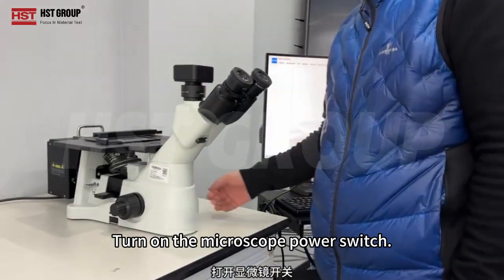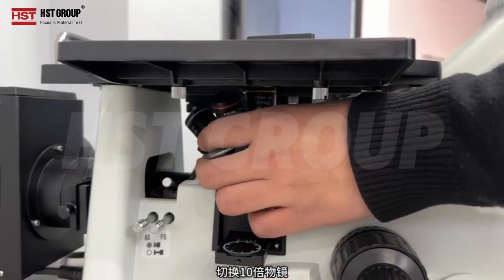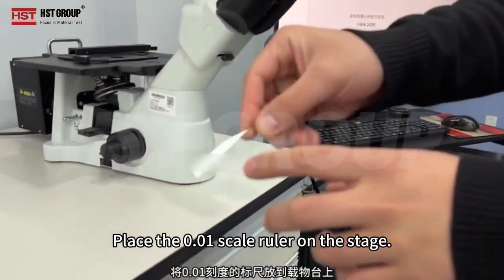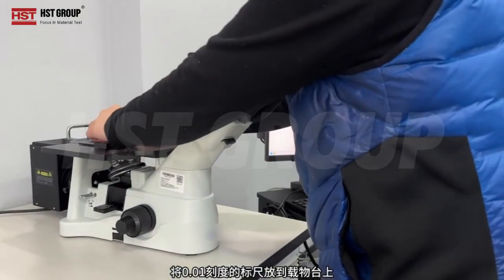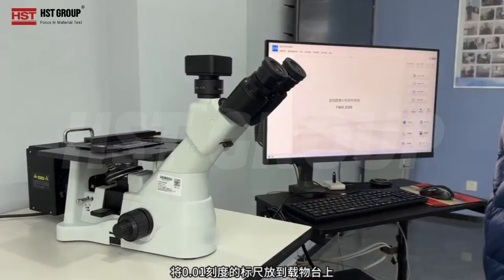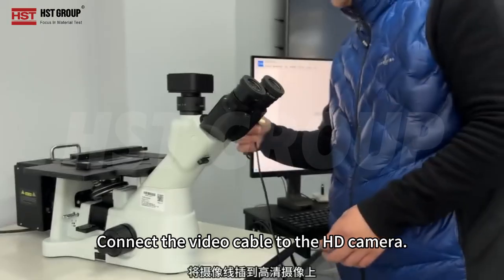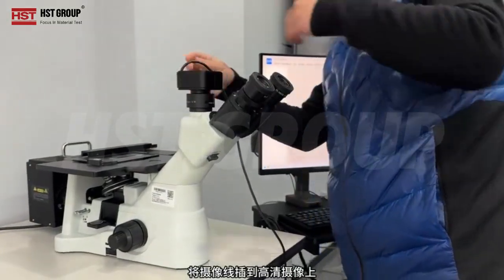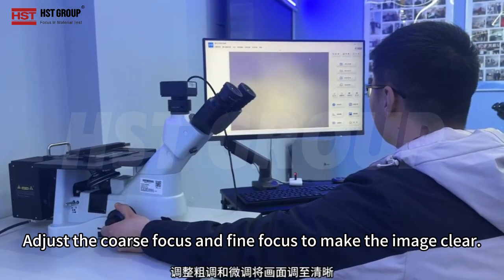Turn on the microscope power switch. Switch to the 10 objective lens. Place the 0.01 scale ruler on the stage. Push the switching lever to the left. Connect the video cable to the HD camera. Adjust the coarse focus and fine focus to make the image clear.